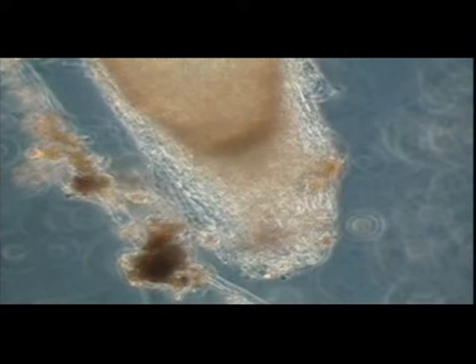The plant stems and leaves were arranged so that they were just above the nutrient solution. The boiling tubes were incubated at 20 degrees centigrade, either in the dark or in sunlight. Obviously, the conditions on roots in soil are more complicated than recorded here, but this technique does illustrate the range of protozoa present on the root surface and some of their interactions. Protozoan activity on the root surface is most intense near the root apices and where lateral roots emerge from the main roots.